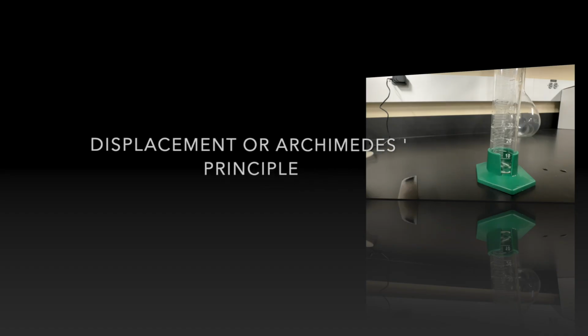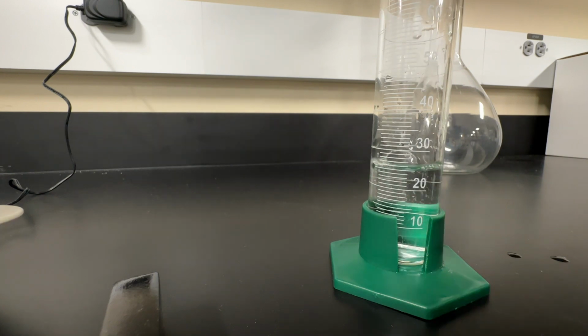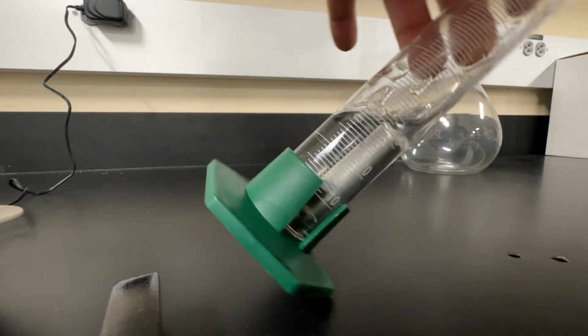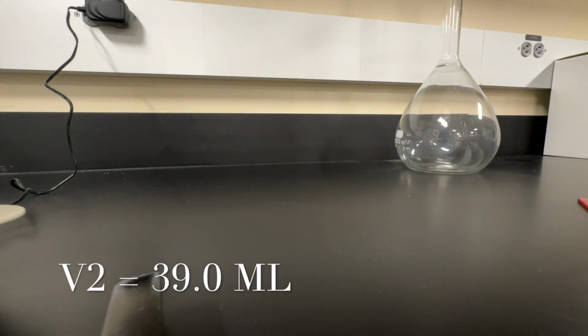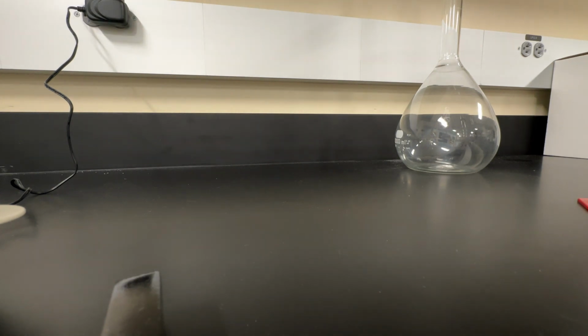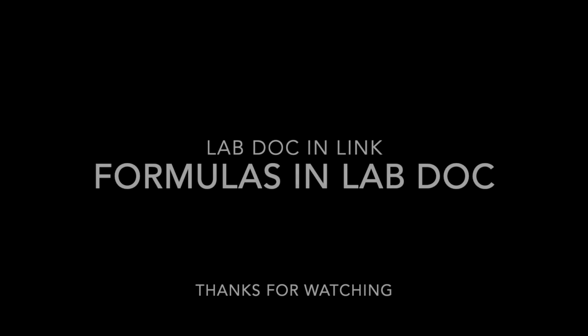Another way to measure volume is displacement, or Archimedes' principle, where you take a volume of liquid. In this case, we're using our water in our graduated cylinder. Then we're going to add our irregularly shaped object to it, and it will displace water and provide us a new volume. However much water it displaces, so the difference between the second volume and the first volume, is the volume of the object. Keep in mind that 1 milliliter is equal to 1 cubic centimeter.